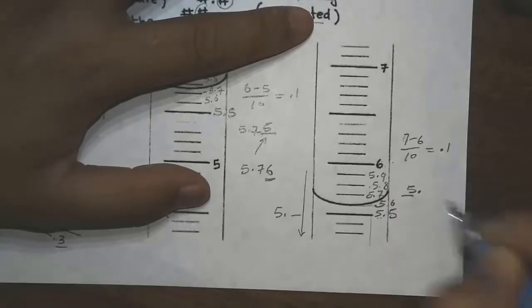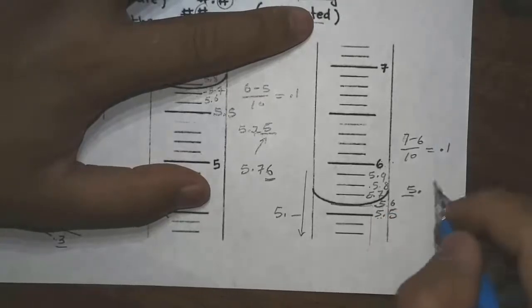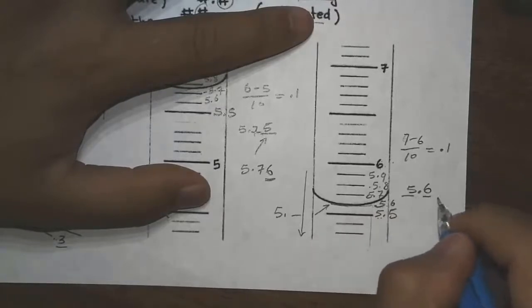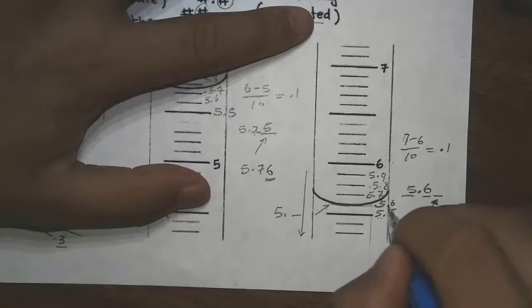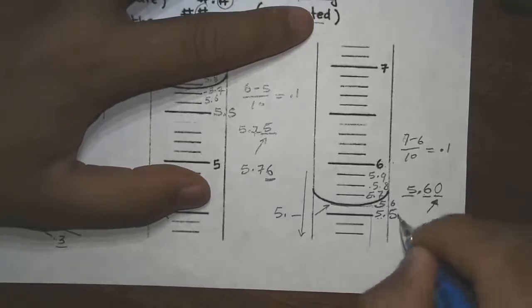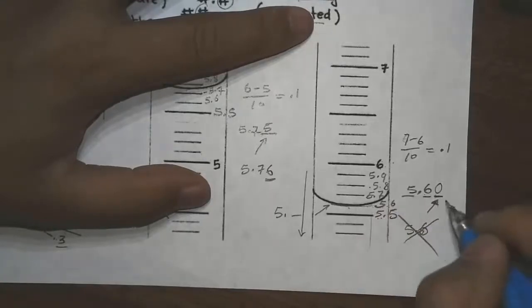So we know for sure it's a 5 there. And we also know that this marker right there has to be above or below that mark. In this case, it is right on the mark, so it is 5.6. We can prove that by looking at this mark right there. But this number is not done because we are not at the estimated digit yet. So we have to show the estimated digit. In this case, it is on the mark of 5.6, so the estimated digit must be a 0. So our answer is 5.60, not 5.6. Because we can prove it, it has to be a 0. This is where we estimate it.